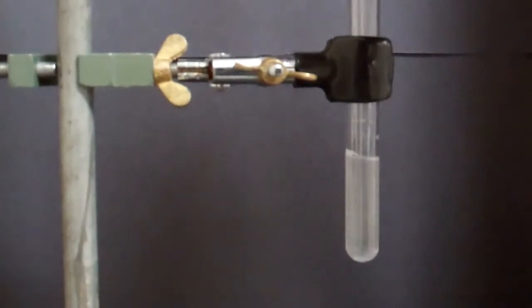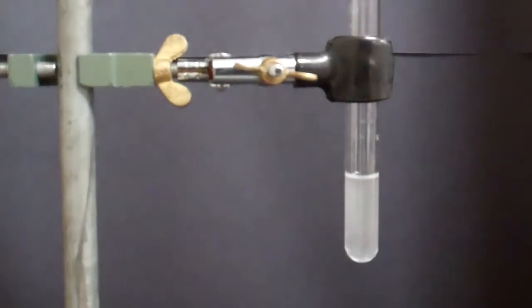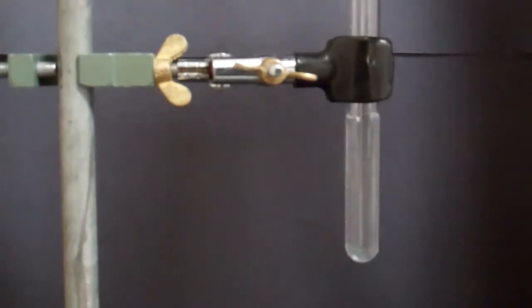Here we go. You can always add more distilled water to get the solid to completely dissolve. That is good.